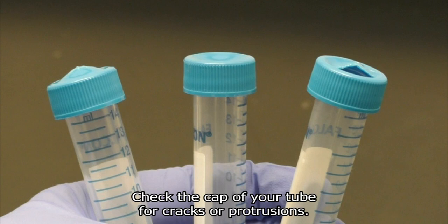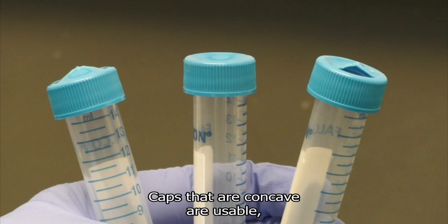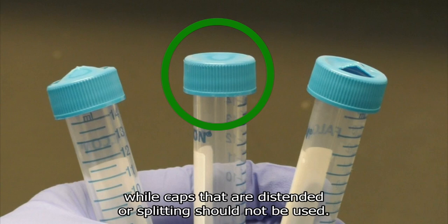Check the cap of your tube for cracks or protrusions. Caps that are concave are usable, while caps that are distended or splitting should not be used.